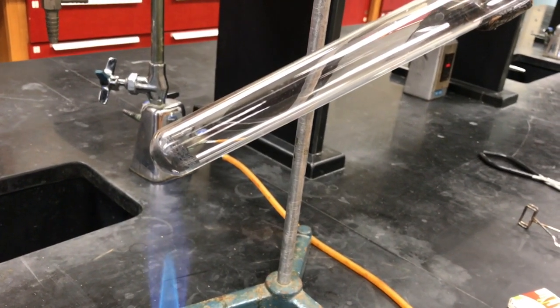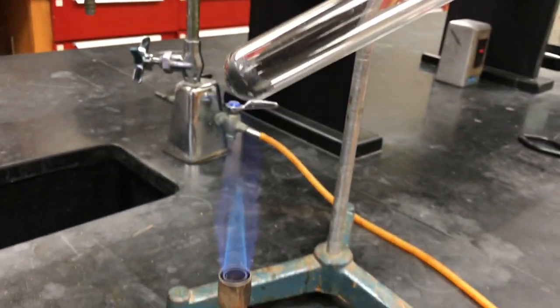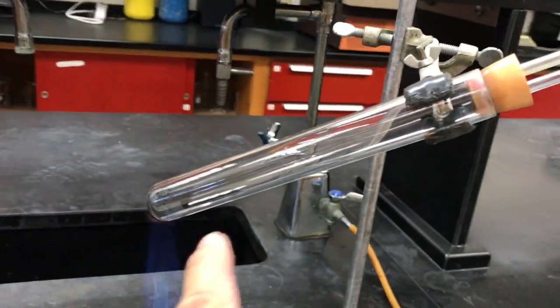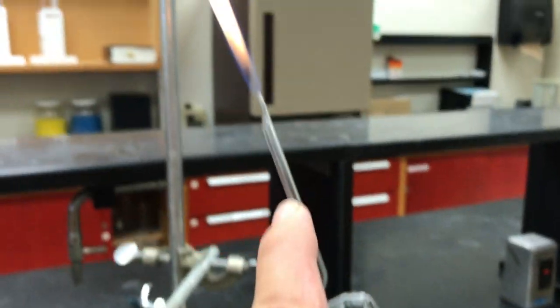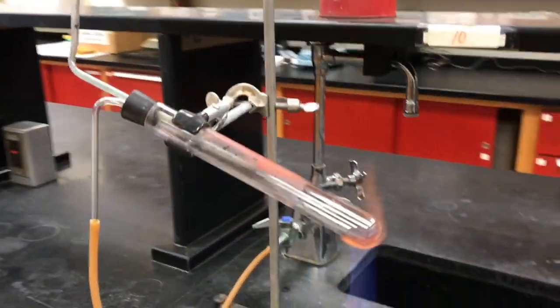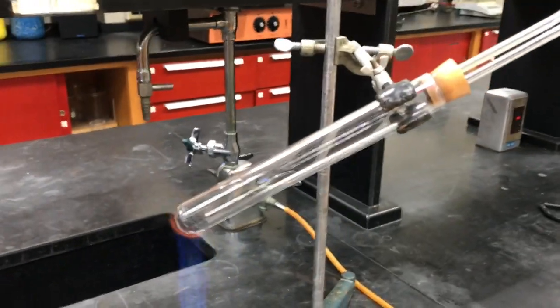This is the apparatus for the black sample, and of course it's starting as black, as you can see. And I have it set up the exact same way as the red sample, with the methane traveling in through the hose into the test tube, reacting with the copper oxide. Carbon dioxide, water vapor leaving, as well as the excess methane leaving. So I've got both of these running simultaneously. There's the black, there's the red. Well, red is black now, but it started as red. And we're going to let these guys run.